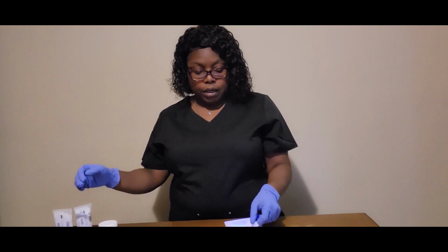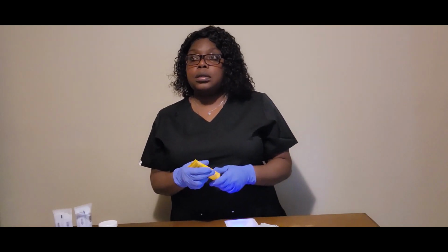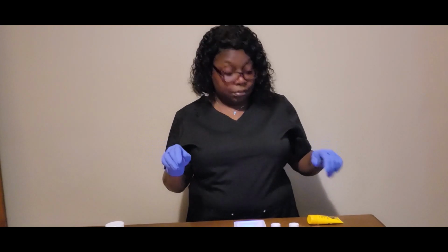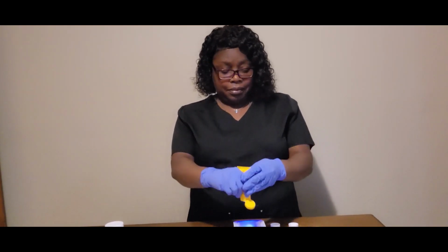Okay, first I'm going to weigh out the 6 grams of the nitroglycerin ointment. Just one moment. What was I going for? 6.